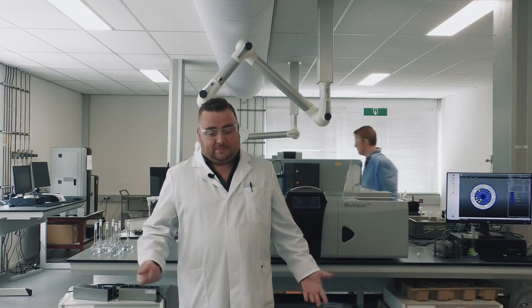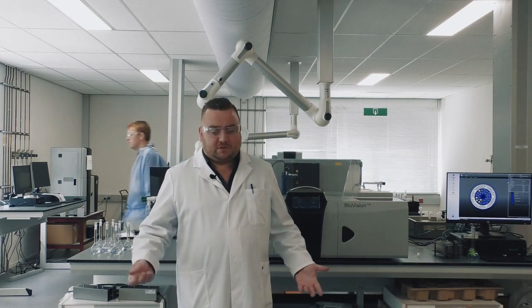And these kind of detection limits would only have been previously available on continuous flow technology. And also the fact that they are disposable eliminates any possibility of poor results coming from the contamination of previously used cuvettes or scratched or otherwise damaged cuvettes, and that really does contribute to these low MDLs, as I've just mentioned. Which brings us nicely to question number 5.